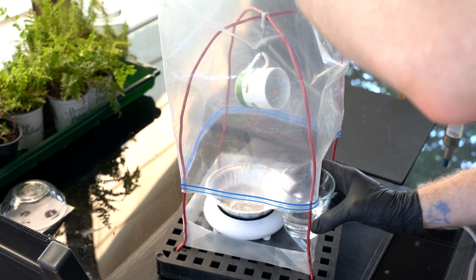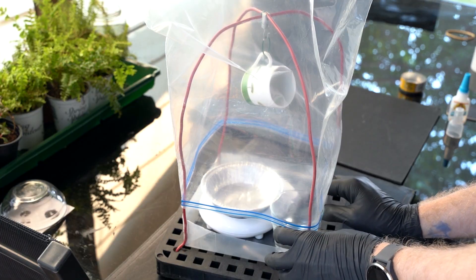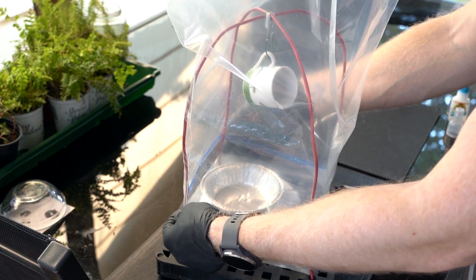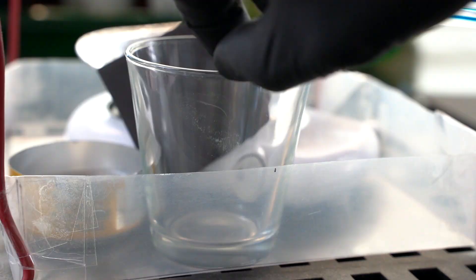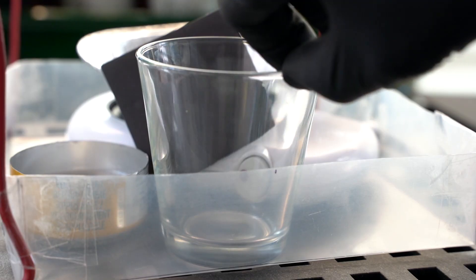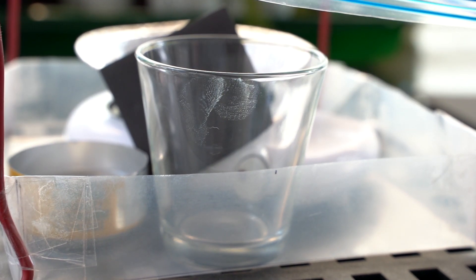A container of water should be placed inside the chamber to provide sufficient humidity for the development of the prints. This is because low humidity causes the appearance of weakly developed prints with poor contrast. The development process should be regularly inspected to avoid overdevelopment.